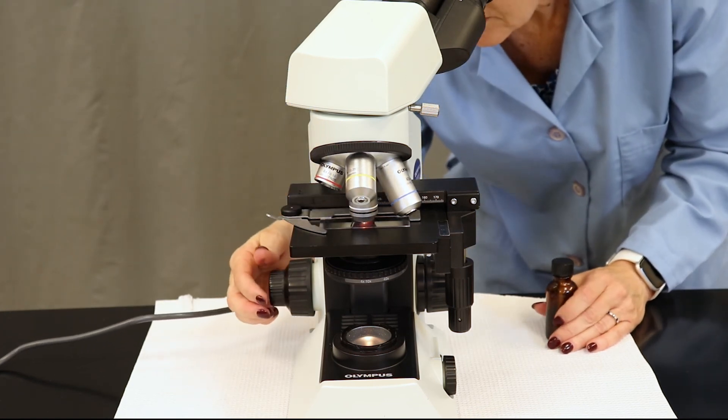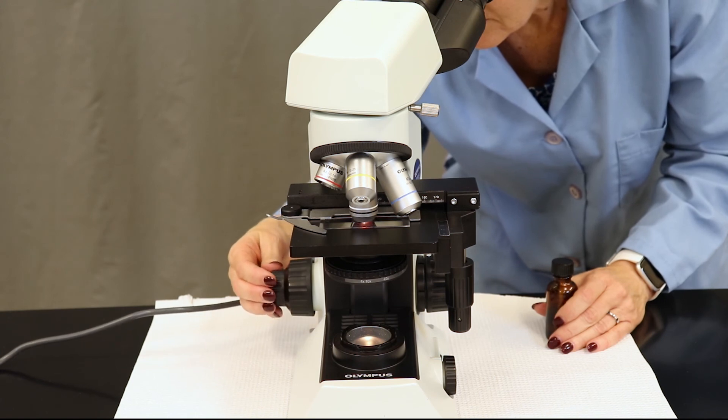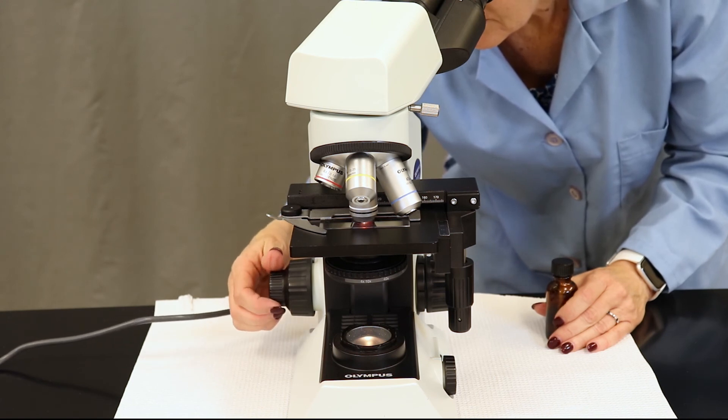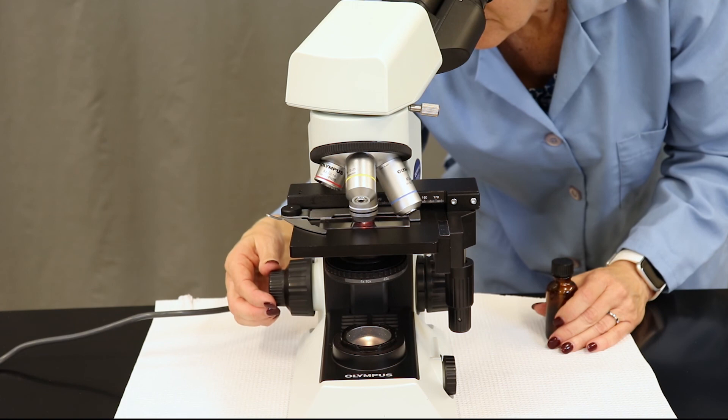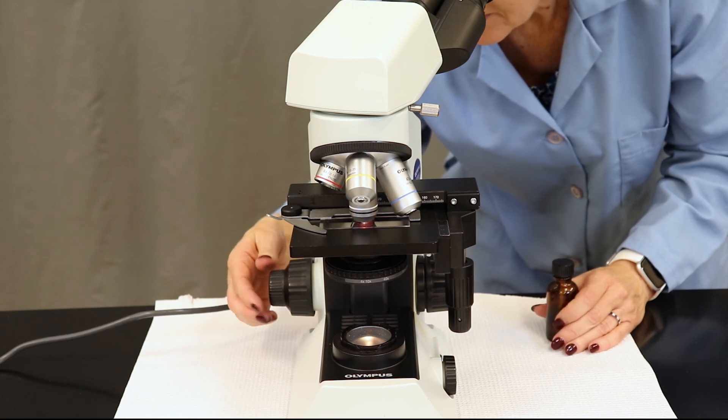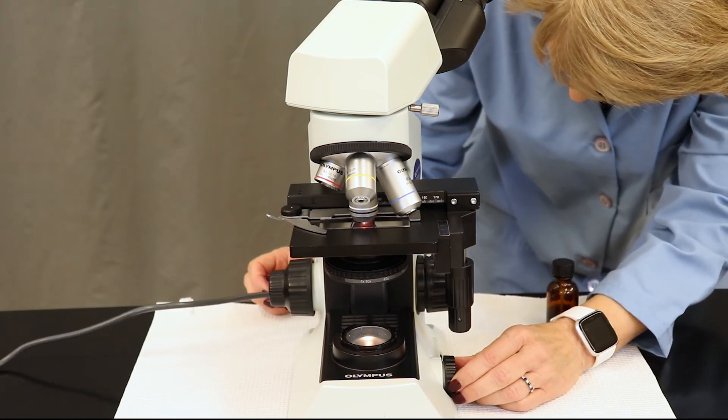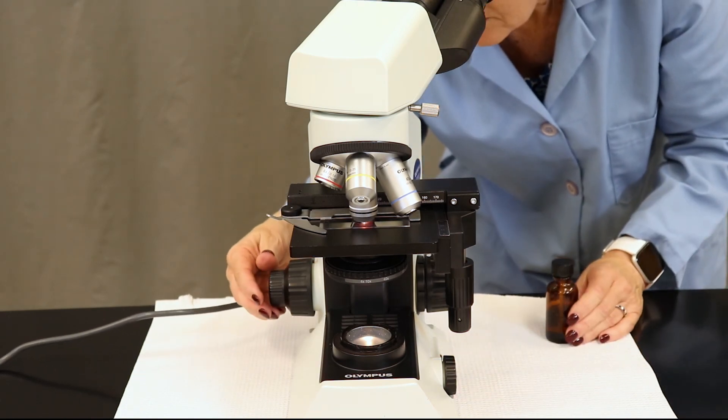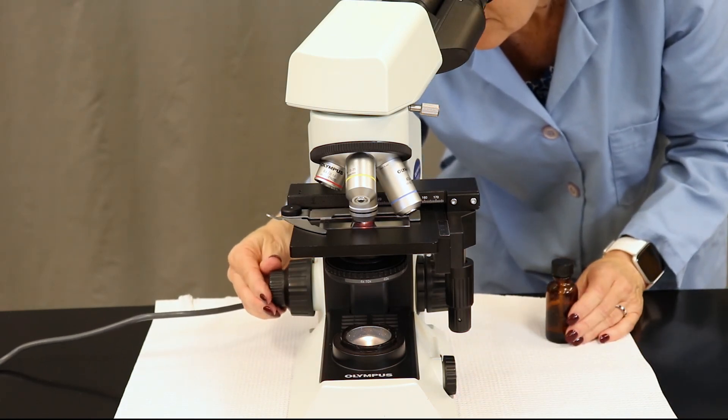Take note, in order for this to work, you really need to make sure that your objective makes physical contact with the oil. Ideally, you should be able to use your fine focus until cells become clear.